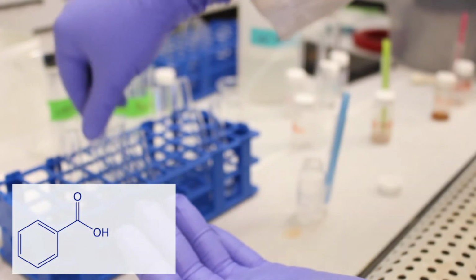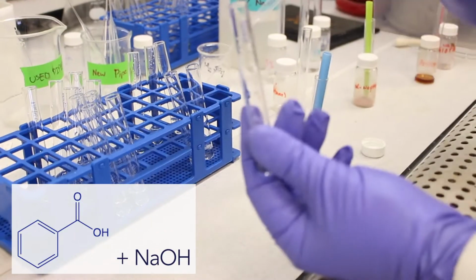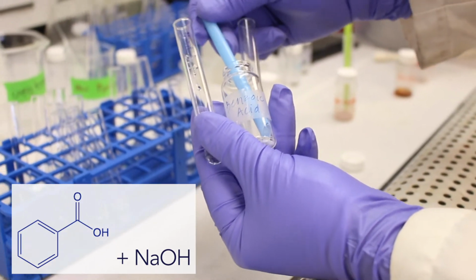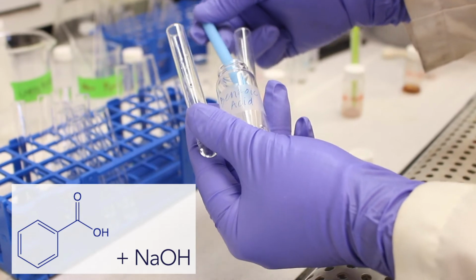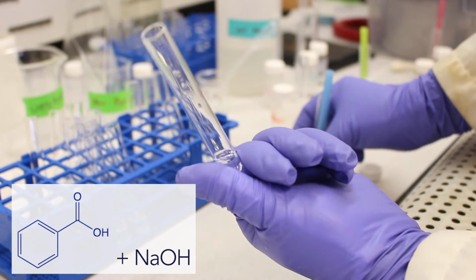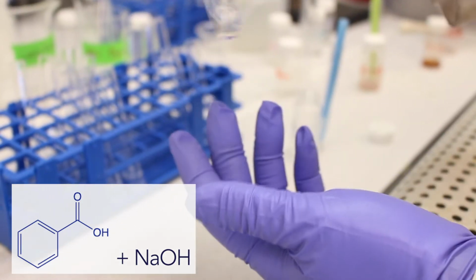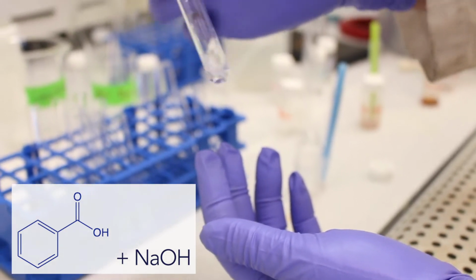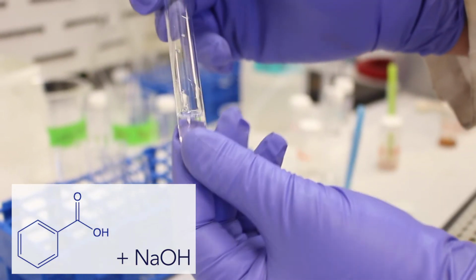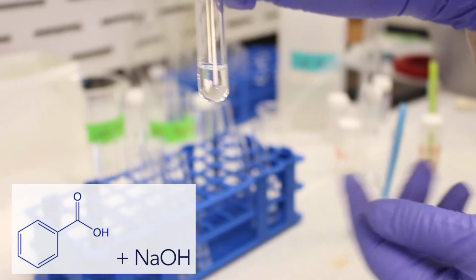Okay, now we get to a strong base like sodium hydroxide. Sodium hydroxide is a strong base, and when we react it with a strong organic acid, it will deprotonate the benzoic acid, which makes it soluble. So we expect this benzoic acid to dissolve in sodium hydroxide. You can see some crystals right there. And once we agitate it, we can see that it's dissolved. I had to agitate it quite a bit because the crystal size of the benzoic acid is quite high.